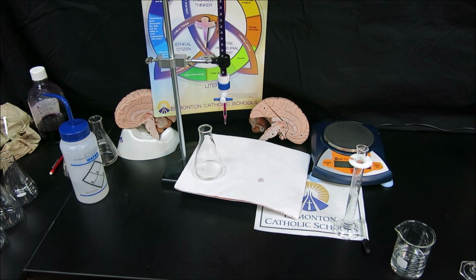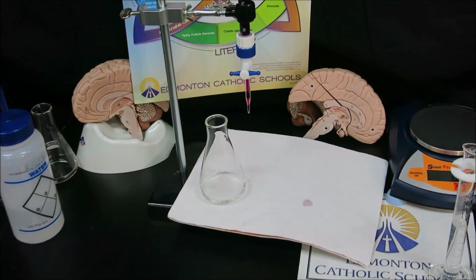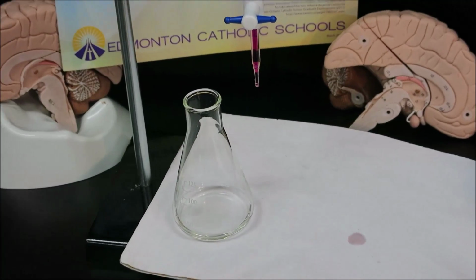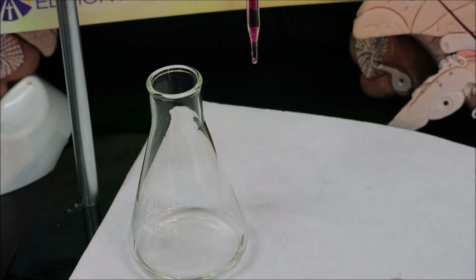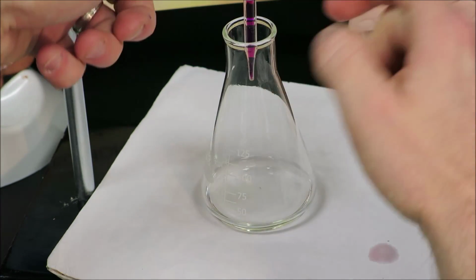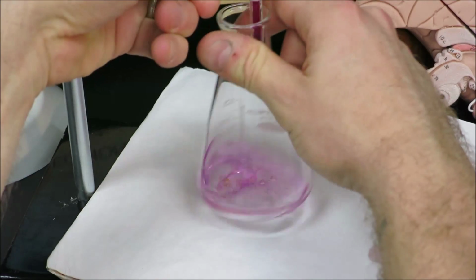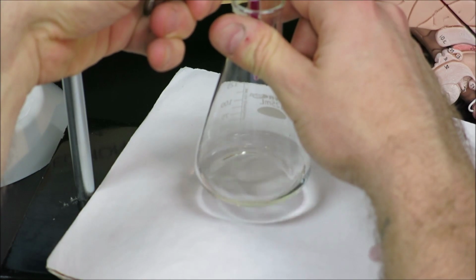So now we have our first peroxide titration. We'll zoom this back in. The endpoint that we're looking for is the same endpoint as it was in the iron solution. We're ready here with our initial volume to be 6.5 milliliters. And then we will go ahead and perform the same titration as we did the very first titration from the iron, which involves a slow drip pattern. Very slow drip pattern here.